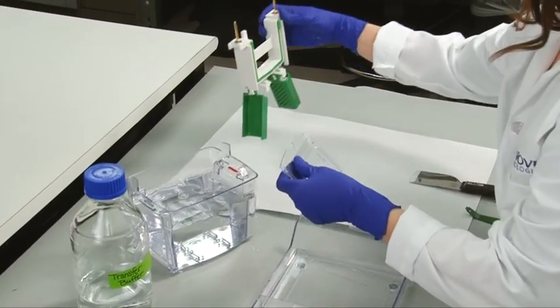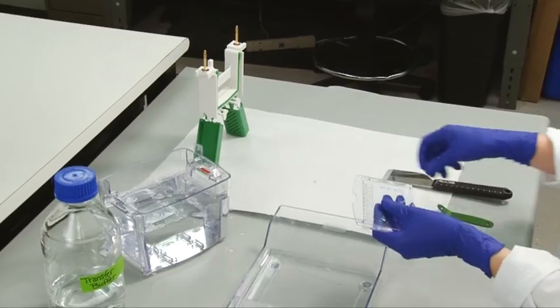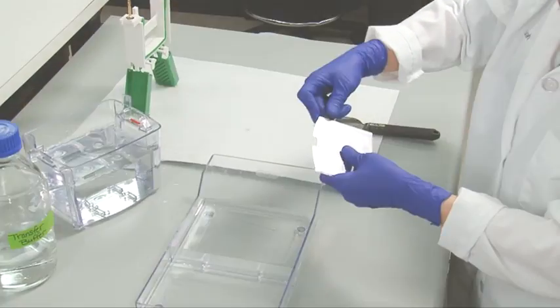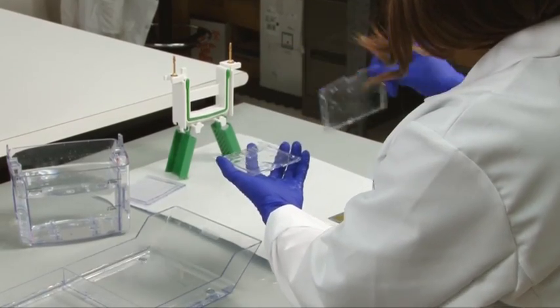Transfer can occur under wet or semi-dry conditions. Here we will demonstrate the traditional wet transfer method. Start by removing the gel from its cassette, cutting off the top portion containing the wells.